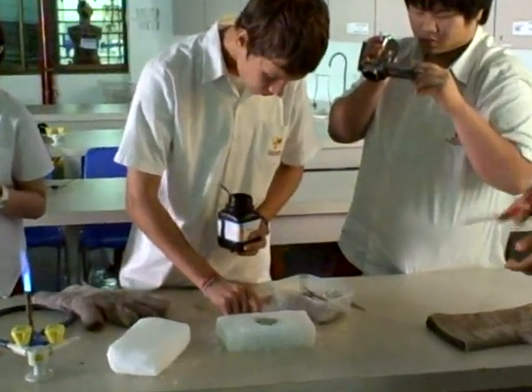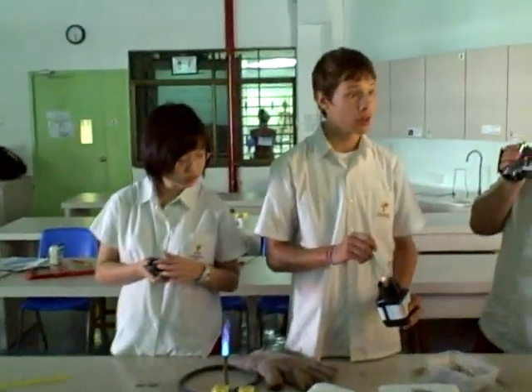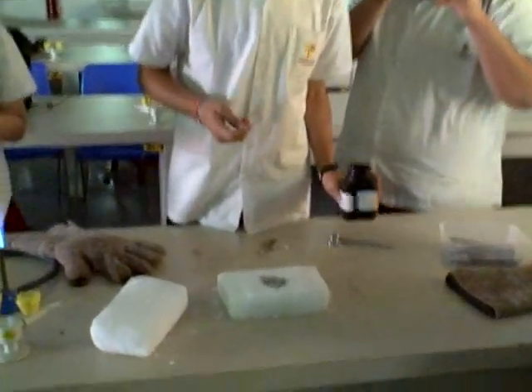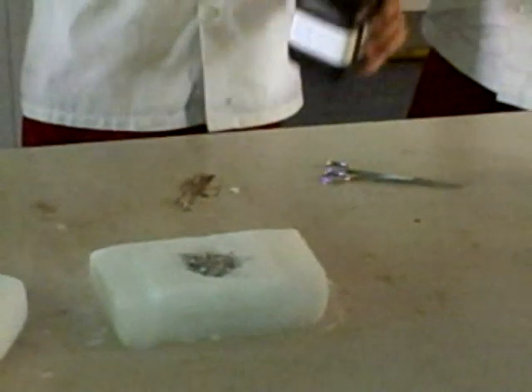Magnesium will make the lights and then the flame will cause it to evaporate. Grade 10, we're doing the magnesium turnings with dry ice for a glowing effect.